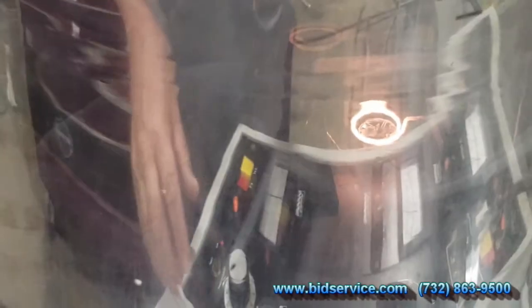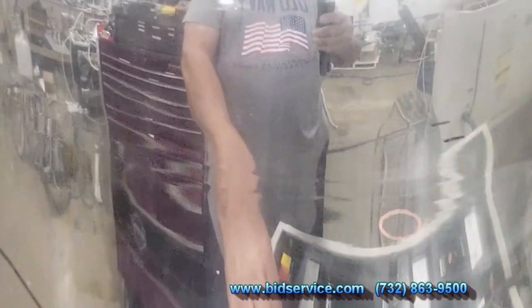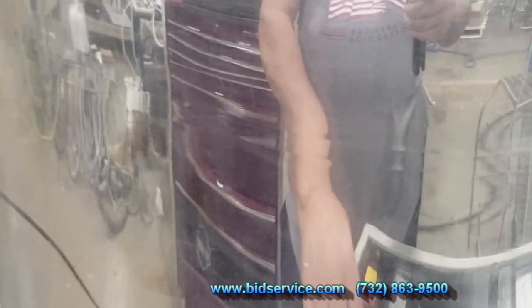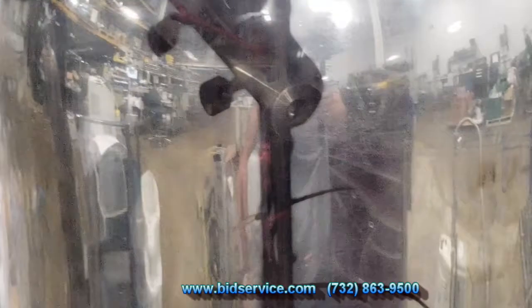Right now about 60 amps. It looks like the whole thing kind of dimmed, but what happens is if you go further up you're going to see the whole jar is getting coated. So I'm going to shut the low voltage transformer off and you can see the jar as a whole — you can barely see everything in it.